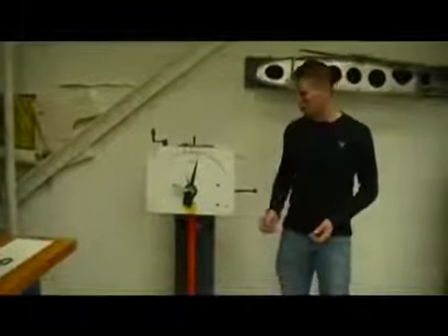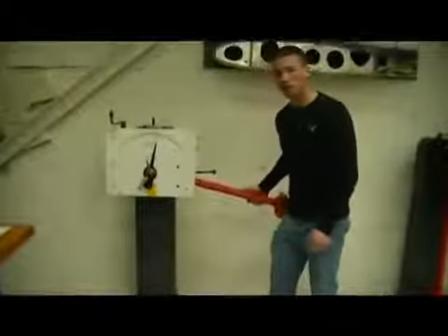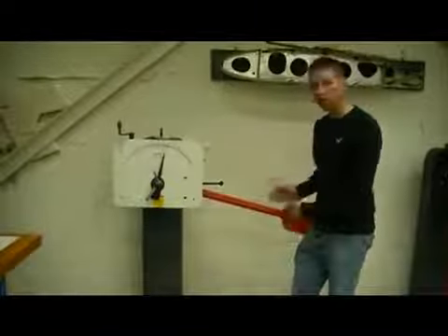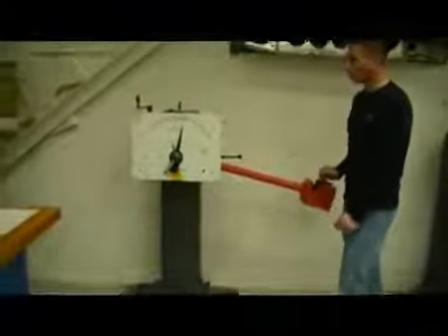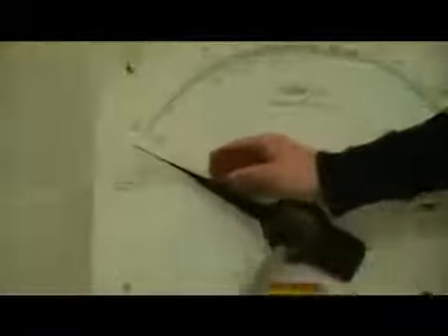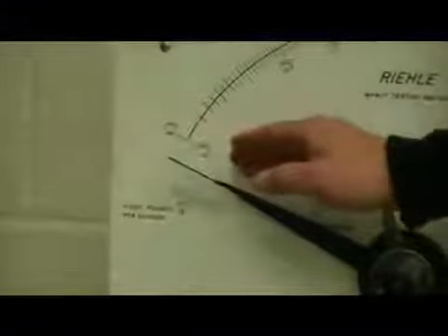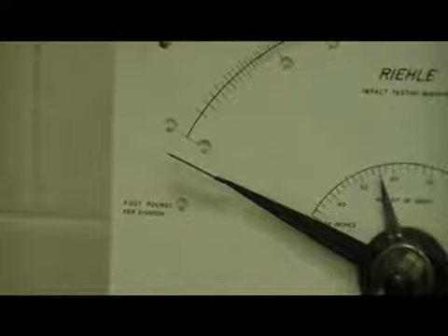In order to do this, we must raise the hammer, and it locks into position here, again at a height of 2 feet from the center of the mass of the hammer to the sample. Next, we must push the dial all the way past the end of the scale. The end of the scale reads 30, and again that's because the total potential energy for the Charpy machine is 30 foot-pounds.